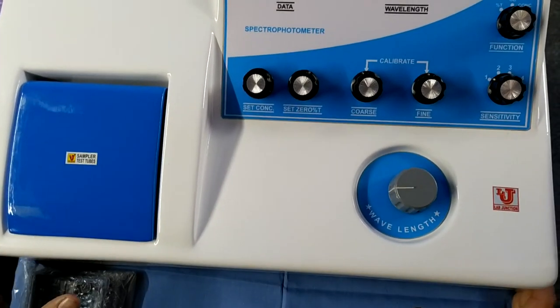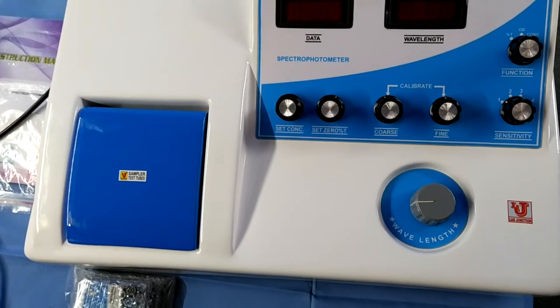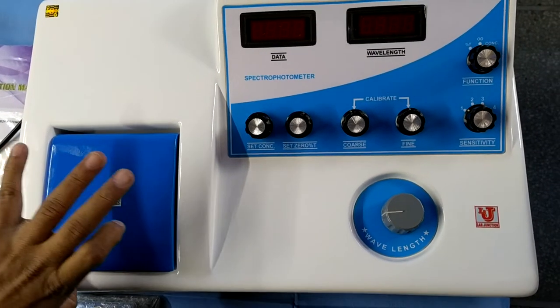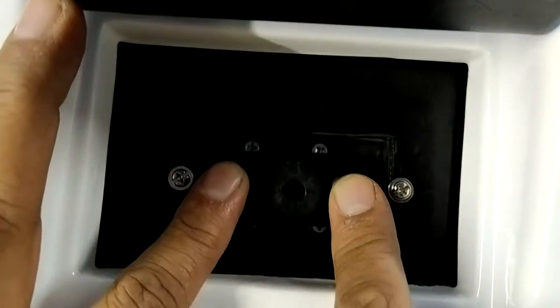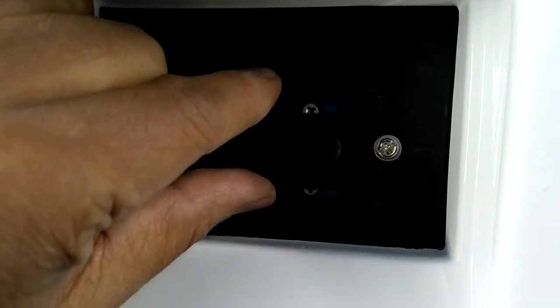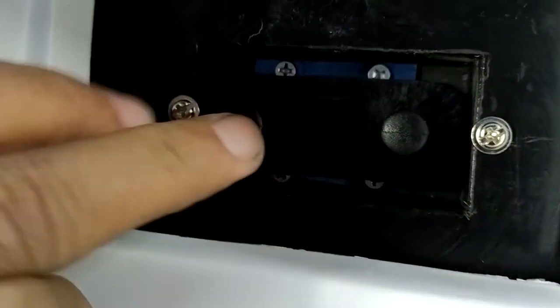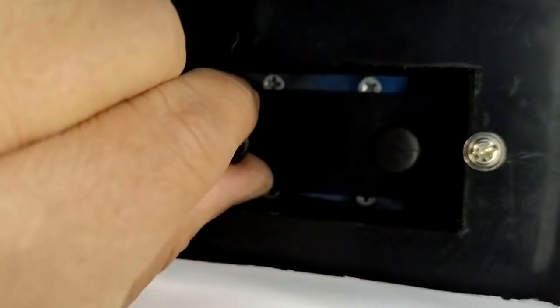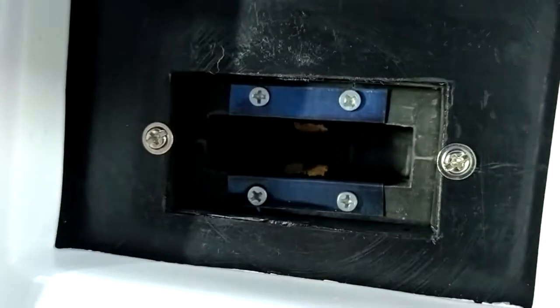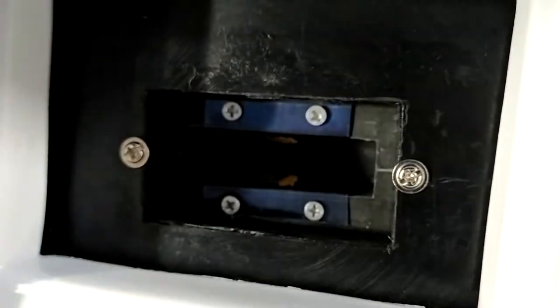This is the main unit of the Digital Spectrophotometer — this is the front view. This is the sampler. This is the dummy, or black body, or dark current for the spectrophotometer. With this jack, this is the 10mm facility glass cuvette. If you want to use 50mm glass cuvettes, then release this jack and place the 50mm glass cuvettes.